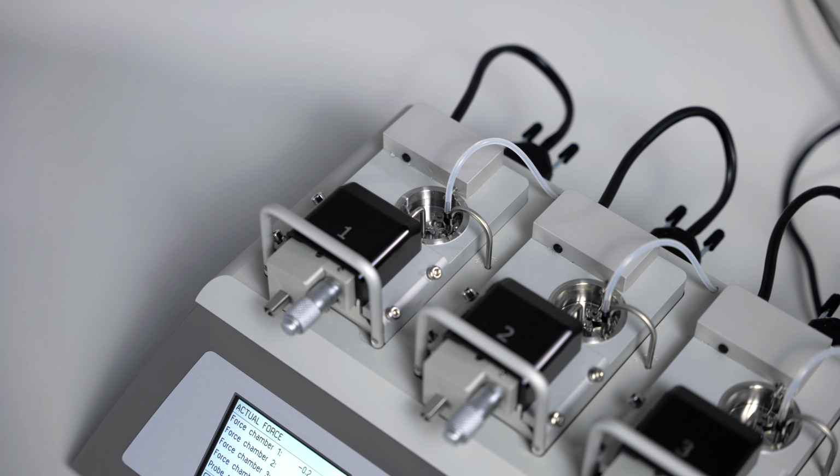At the conclusion of your experiment, remove the tissue and the wires. Also, empty the chamber of buffer. However, keep your gas bubbling.